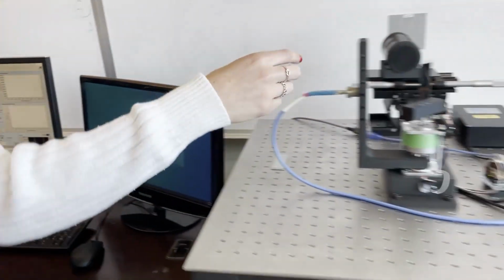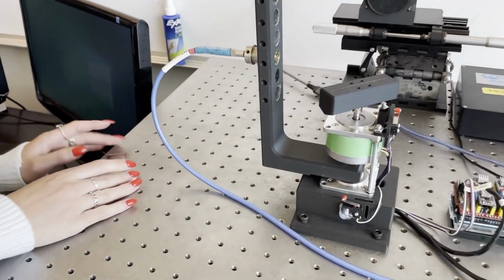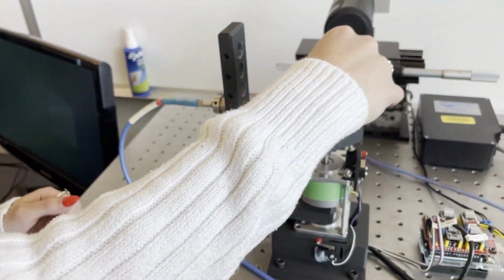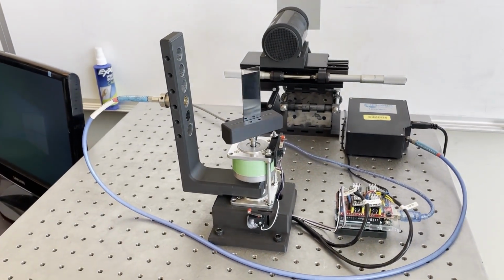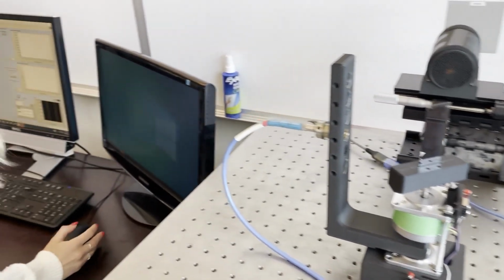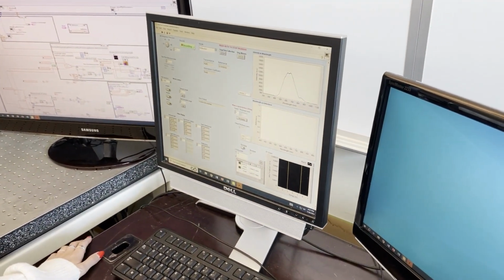And over here, you're going to need to change out your slides for the one that has the thin film on the substrate. In this case, we have PMMA on the chrome. Put that in the slot, go over, and turn your light back on. And then go ahead and hit record again and take your reflection measurement.